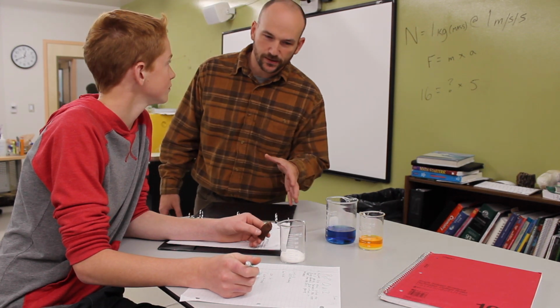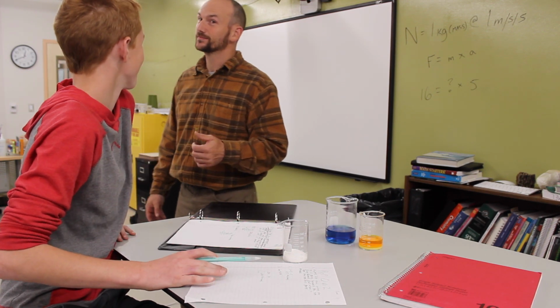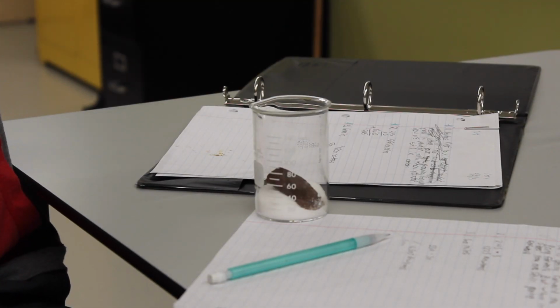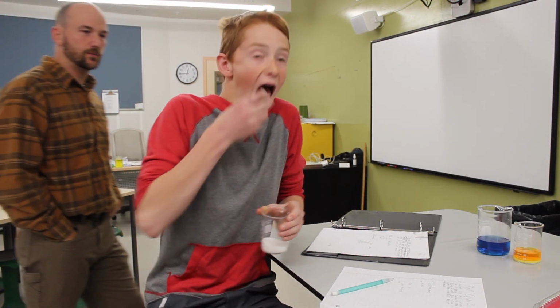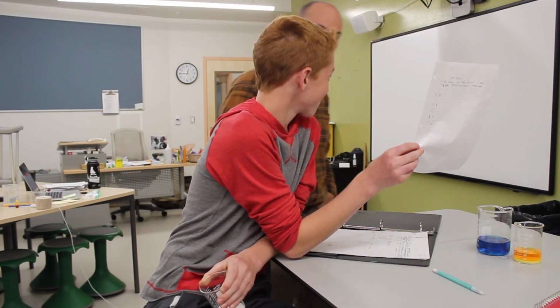How many times do I have to say it? You can't be eating during lab. No, I'm not eating, Mr. Hummel. Oh no. Dang it. Hey, Evan, did you get a good answer for number 4? Alright, looks good. Thanks.